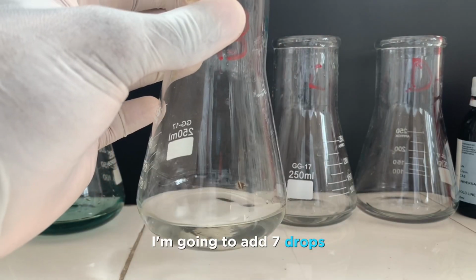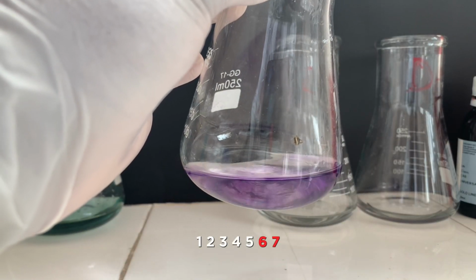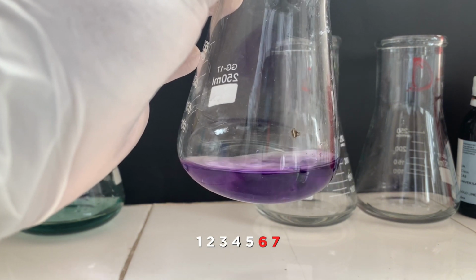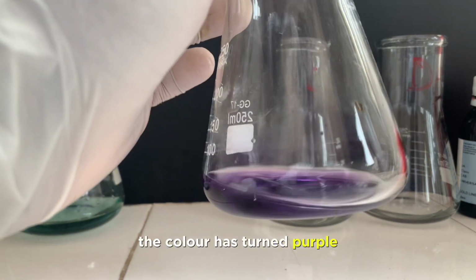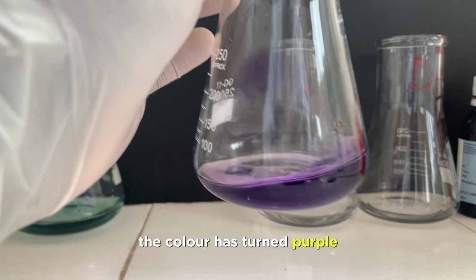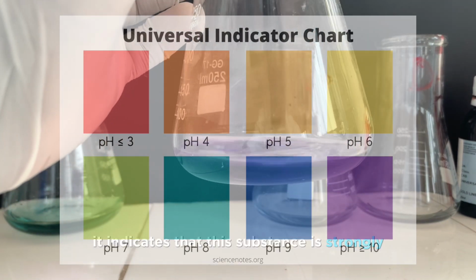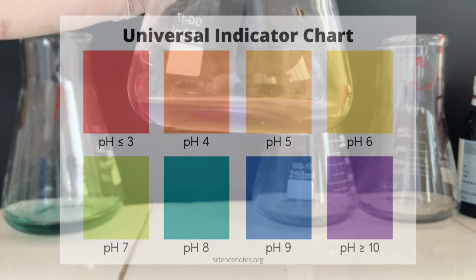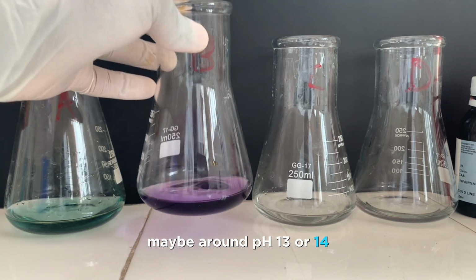The next substance, again colorless, I'm going to add 7 drops. You can note that the color is turned purple. Alright, this is important. So, of course, like I said, you don't need to add 7 drops, just a few, 3 or 4, it's fine. The substance is purple, and this purple is intense. It indicates that the substance is strongly alkaline or basic, maybe around pH 13 or 14.